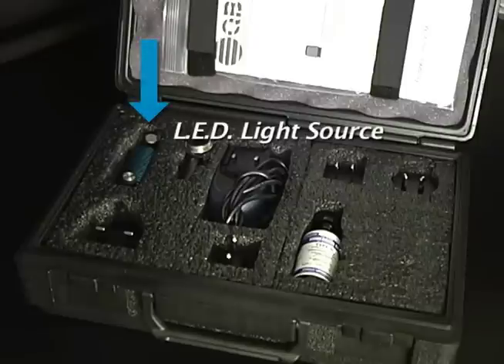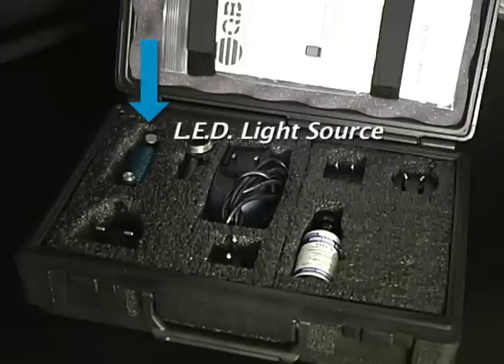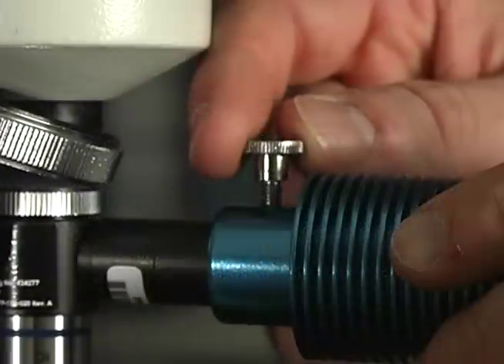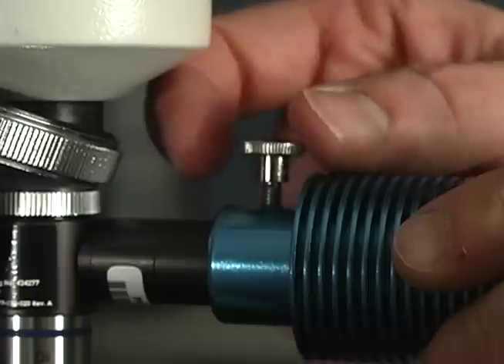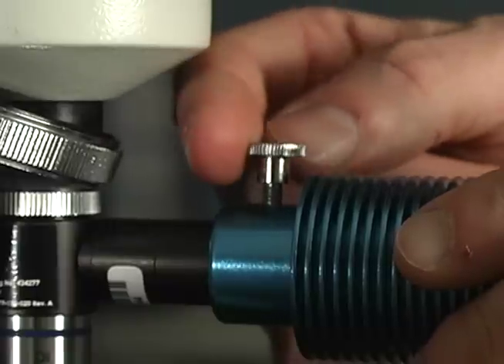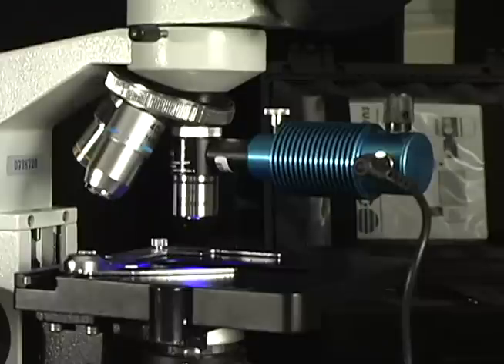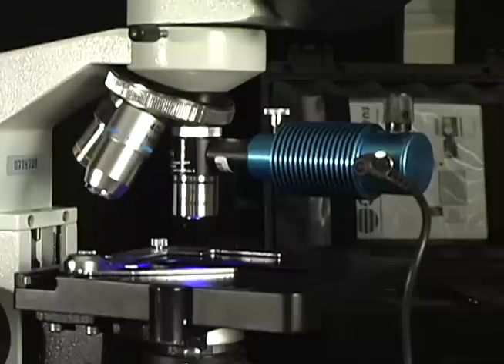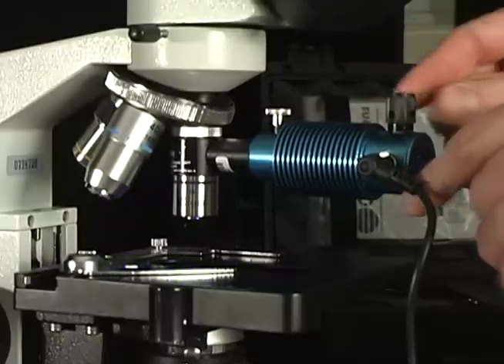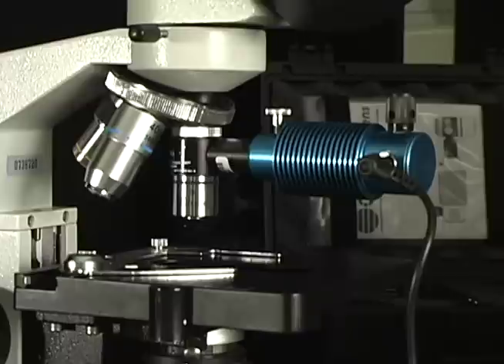The blue light emitting diode, or LED, light source connects directly to the body objective assembly by means of a thumbscrew. An intensity knob, which is located on top of the light source, allows you to increase or decrease the amount of light emittance.